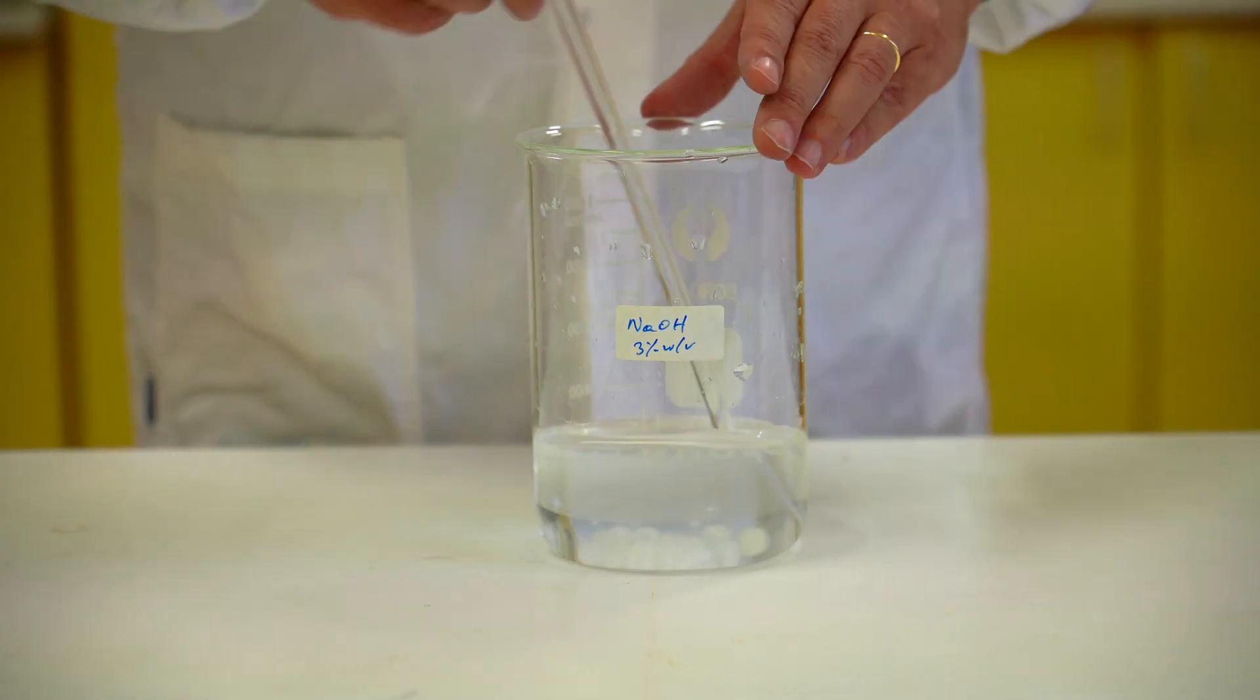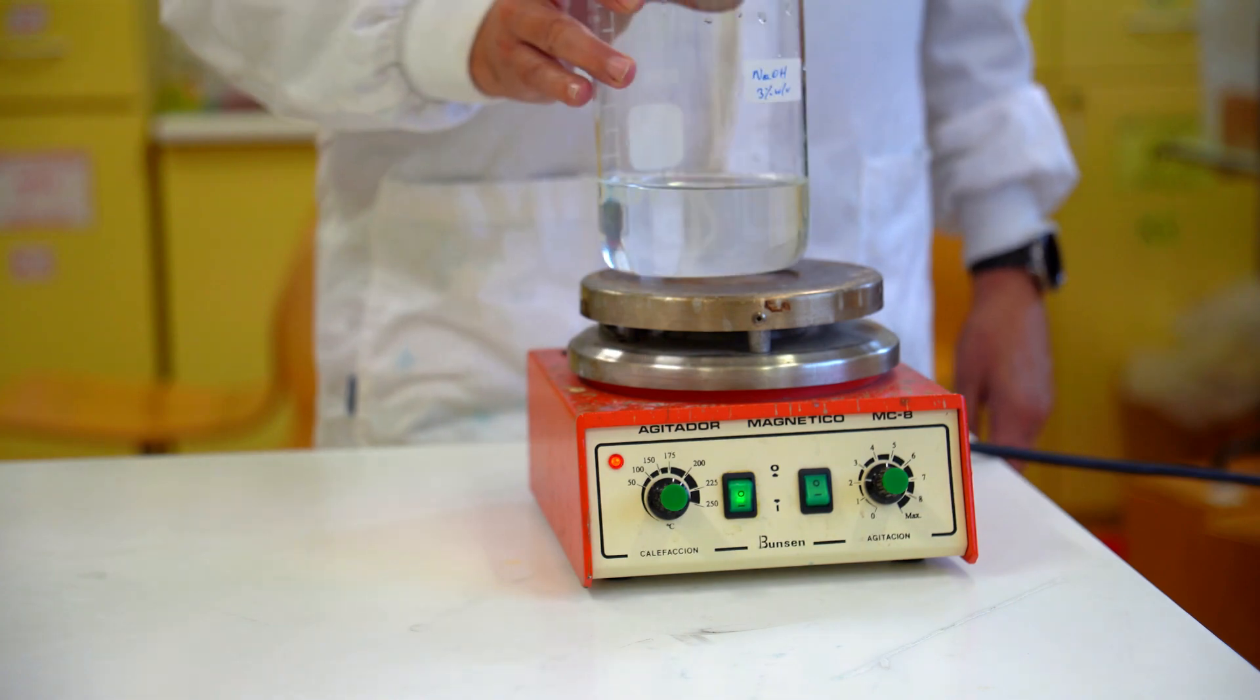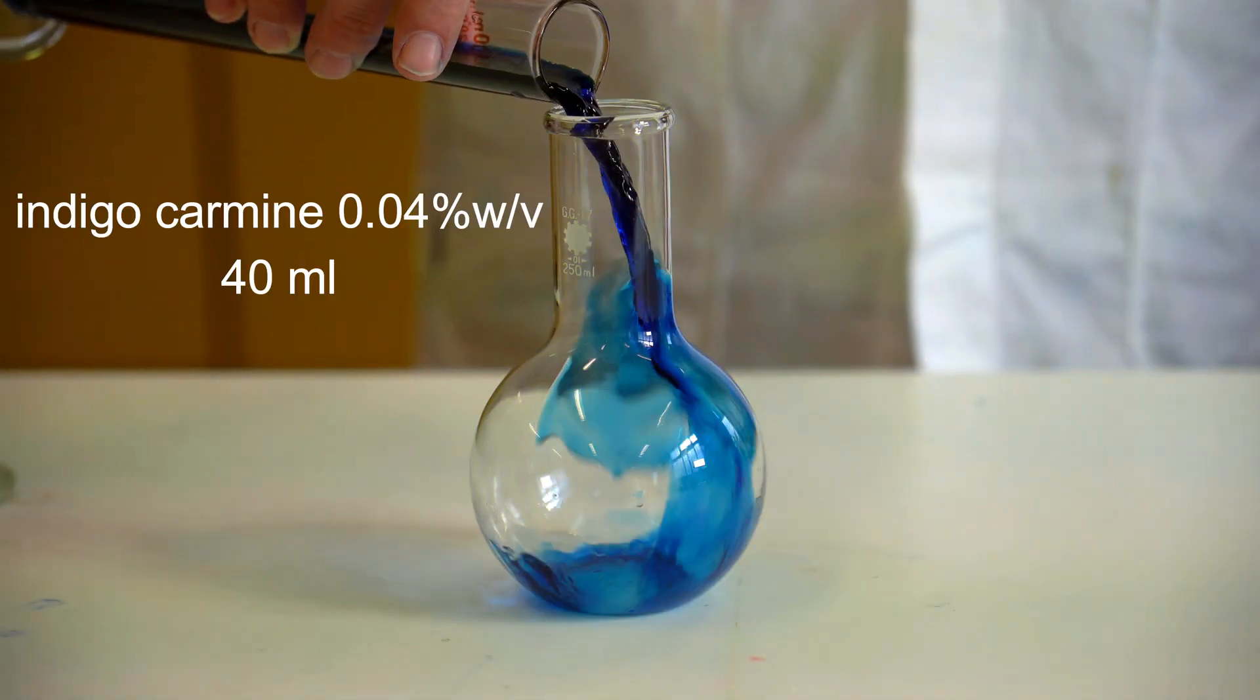This solution must be heated at between 50 and 55 Celsius to optimize the time periods between color changes later on. Now, let's prepare the reaction.